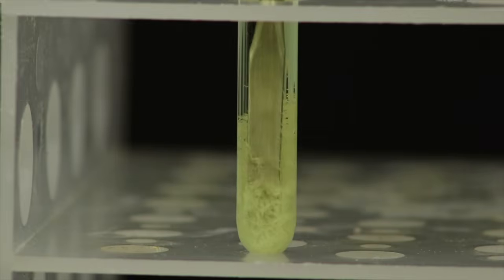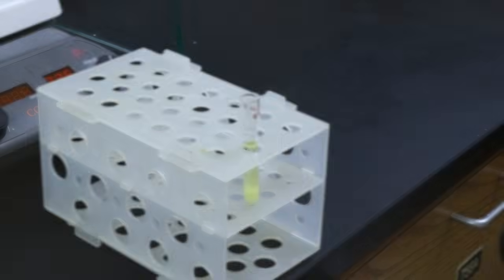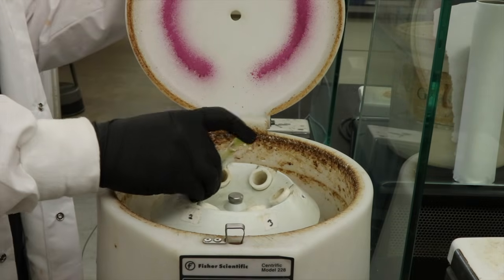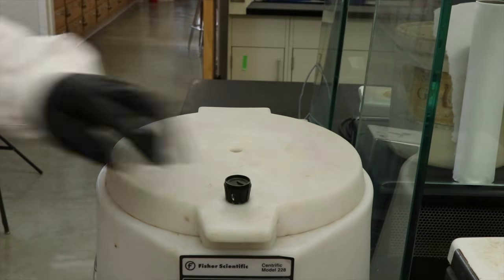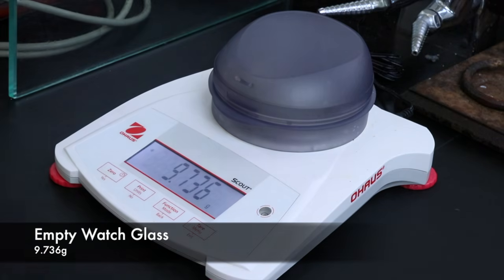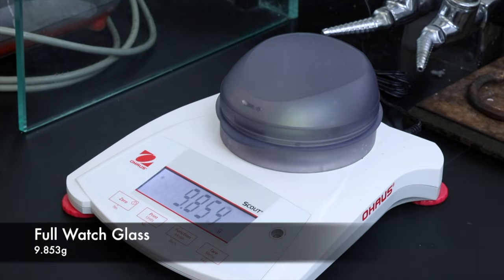I'll break up the crystals a little bit, just so they'll be slightly easier to remove, and then use the stopper and a test tube to separate the crystals from the solution, and I'll let it run in the centrifuge for a couple of minutes. Once I have the pure crystals, I can weigh them out to calculate a percent yield, the empty watch glass being 9.736 grams, and the full watch glass being 9.853 grams.